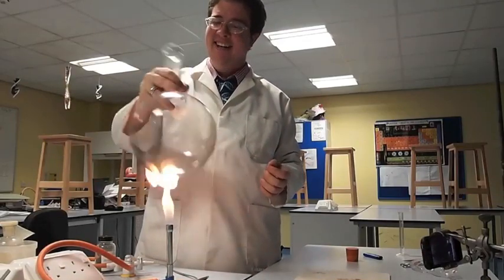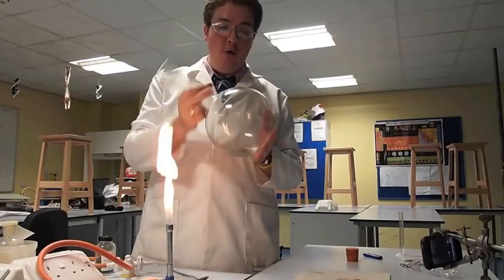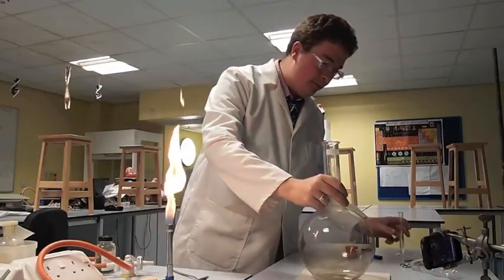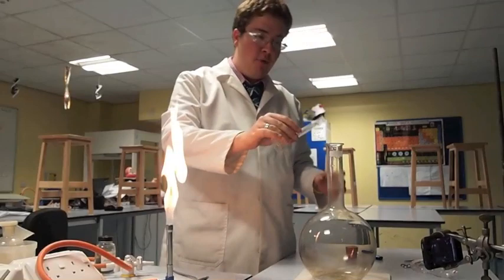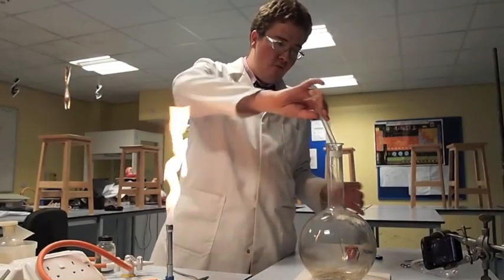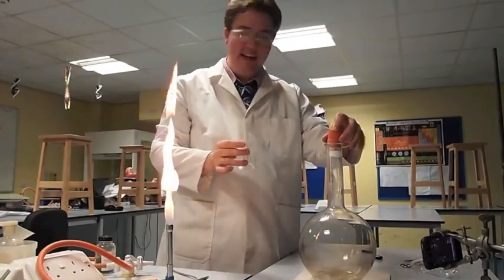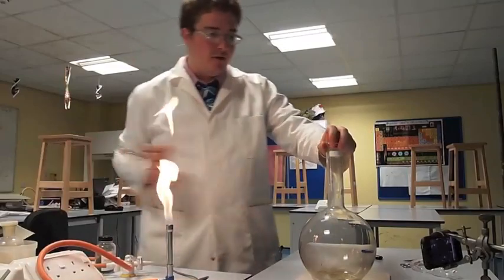So all this extra heat is going to warm our ammonia and make our experiment work a little bit better. Now I'm going to pour the ammonia into our round bottom flask, put the lid on, and make sure it evaporates.